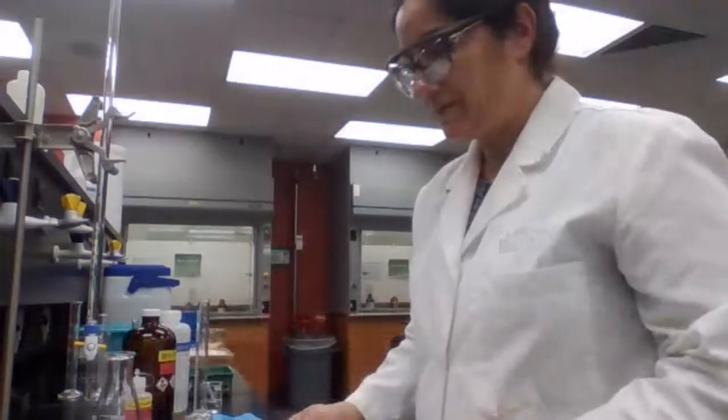Okay, the first test I'm going to do, I'm going to check for carboxylic acid, no derivatives. Okay. So you could just replace the calculation for the derivatives.